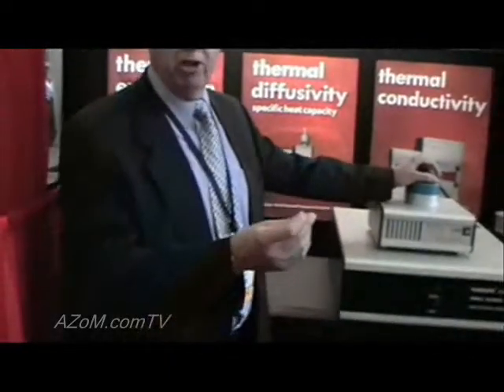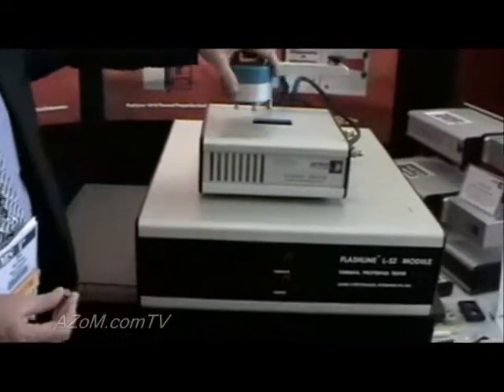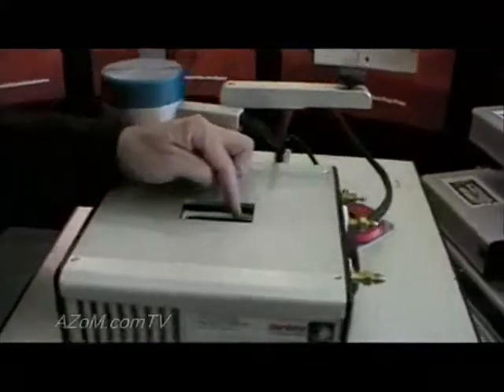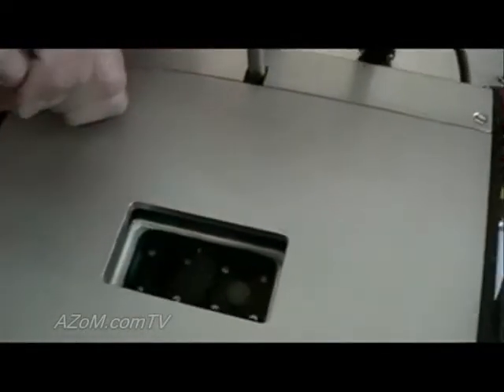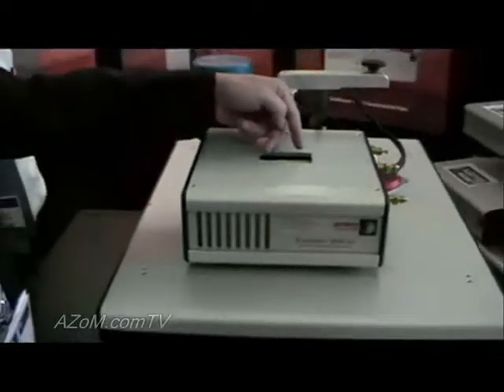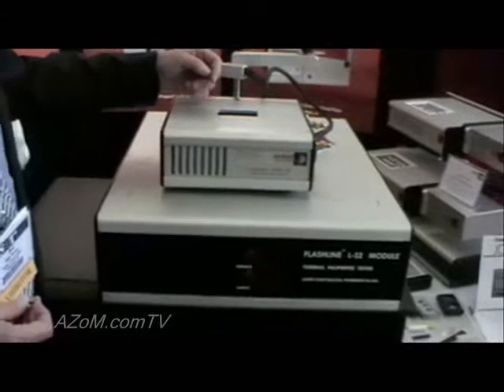Specimen size is relatively small. If you come in a little closer, we can show you the sample holder position where we have dual sample positions. You can see right now a sample — typically half inch diameter, although we have the ability to go as high as 25 millimeter diameter or square for the samples. Two samples, even for high throughput or for comparison for the specific heat capacity measurement.